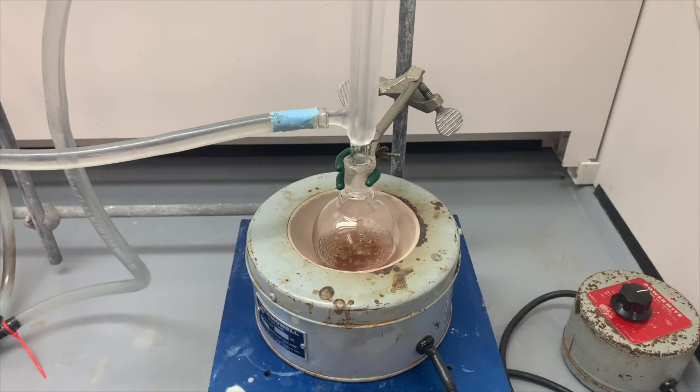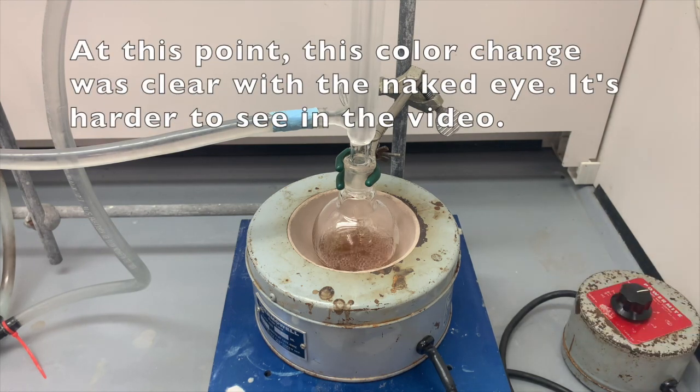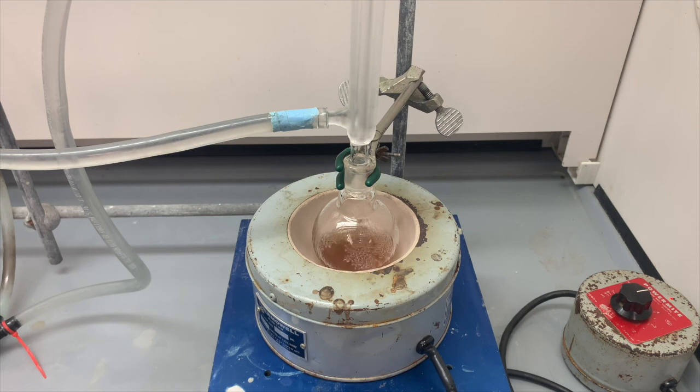After only about 5 minutes, we see what appears to be a color change in the reaction. That used to be a lot darker brown. Now it's a little bit lighter brown. Not much that we can say here, but at least we can see that something is happening. There's an appearance of some type of change in the reaction. So it's been only 5 minutes. We're going to let this reaction run for an hour, so another 55 minutes, and we will come back.